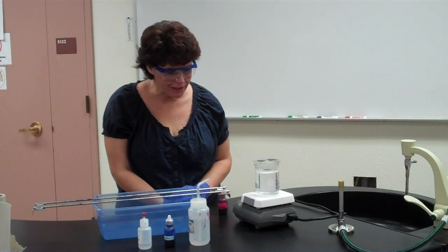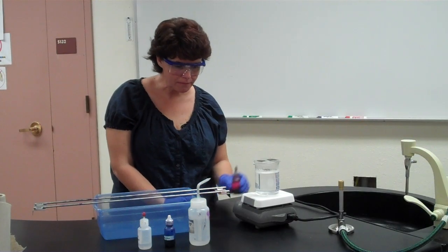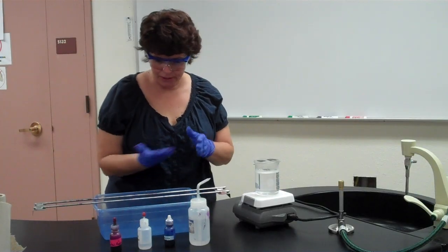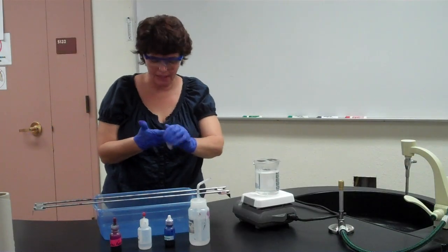The size of beaker that I'm using is a 400 ml beaker. It's the perfect size for allowing you to put the slides on top. So that's going to steam for 5 minutes. I'm just going to let it steam for a little bit and talk about the rest of the reagents. The next reagent we're going to use for decolorizing is going to be the acid alcohol.